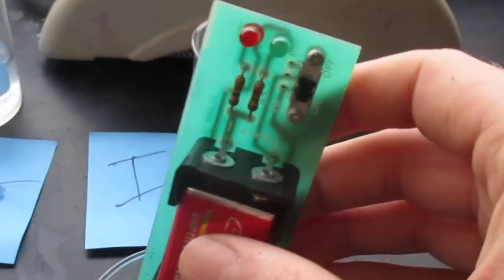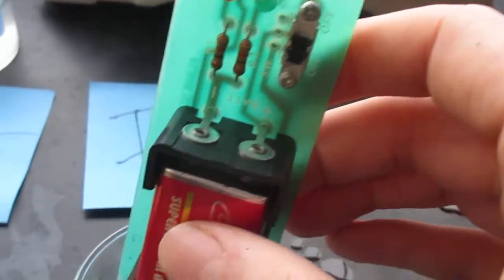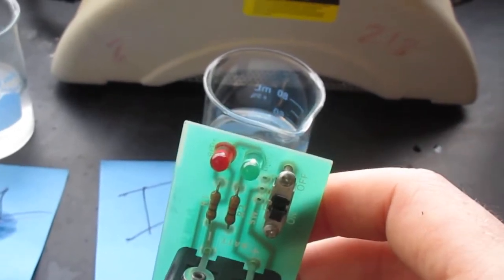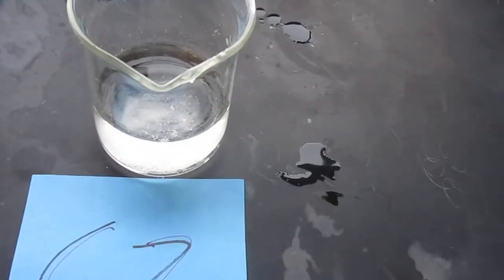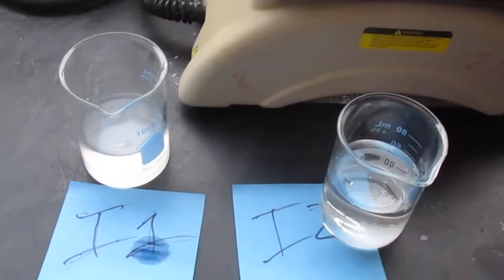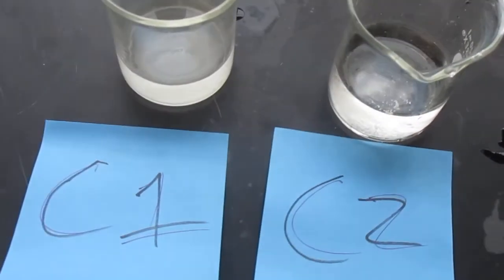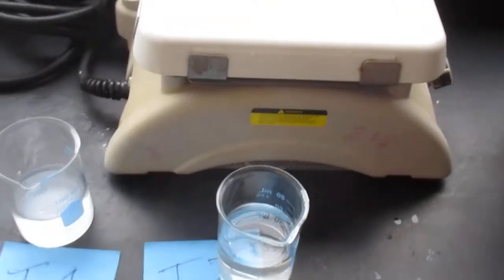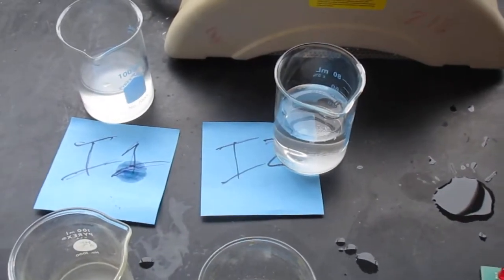Nothing. And nothing. So the ionics conducted and the covalents didn't. That brings us to our unknown section.